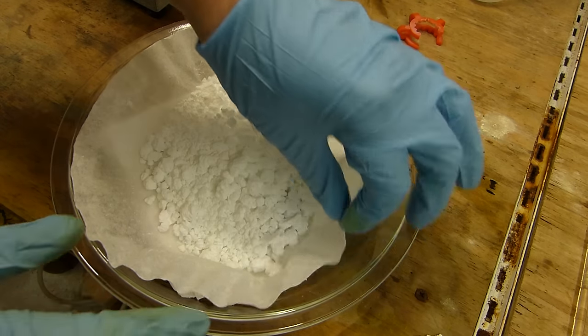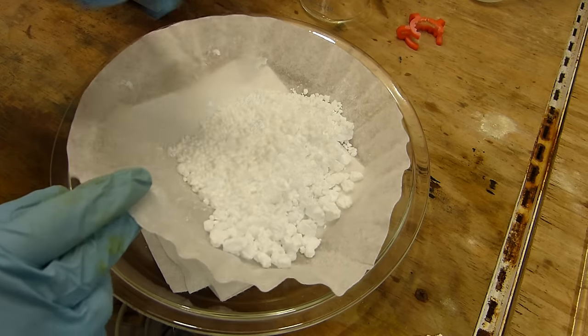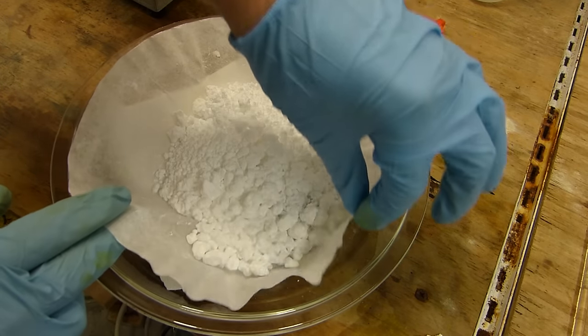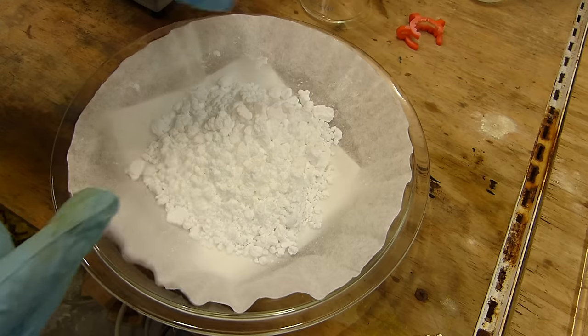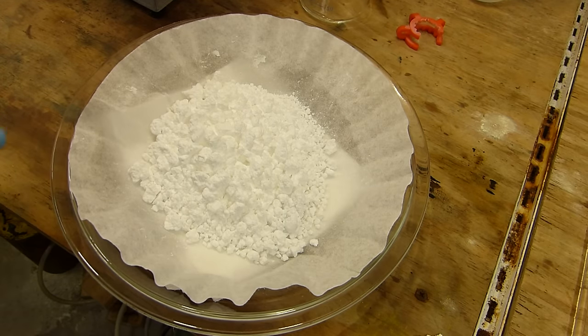It's been a few hours and the benzoic acid is now mostly dry. You can see it's sort of starting to free flow a little bit, a little bit of chunks, so a little bit of water still, but mostly dry, dry enough for the next step, which is recrystallization.